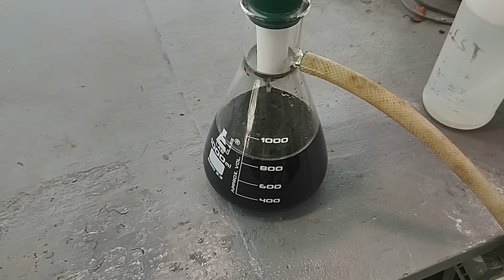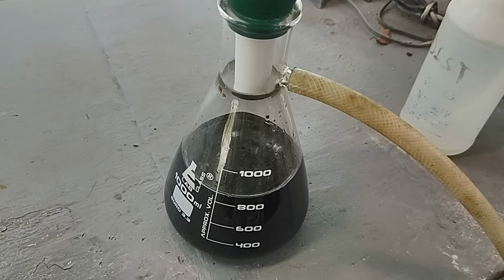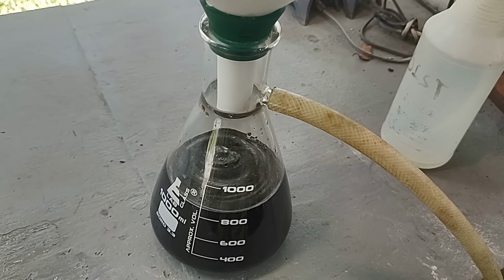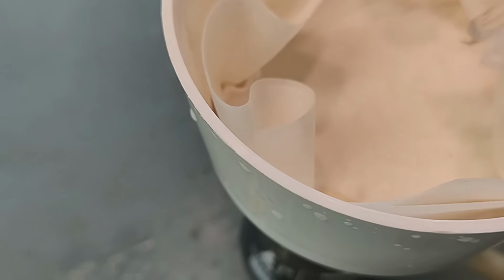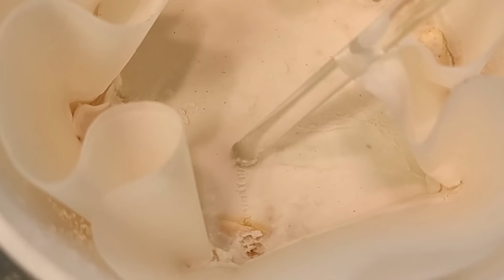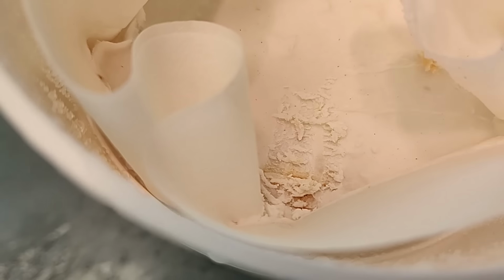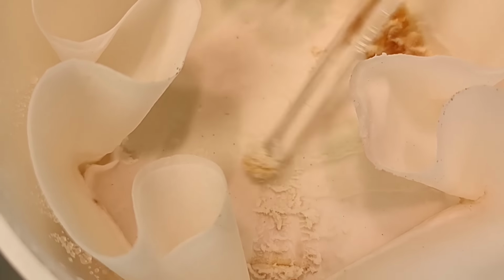Alright, I have been running a lot of water through this funnel with the filter in it up here, trying to get this liquid coming through clean, and it is coming through pretty clean, maybe just a slight hint of red to it still. But let me show you something up here in the funnel. Now look up here in the funnel, there's some orange stuff in the funnel. I just scrape away some of the paper pulp. There's some orange stuff. Now this is orange, not red.